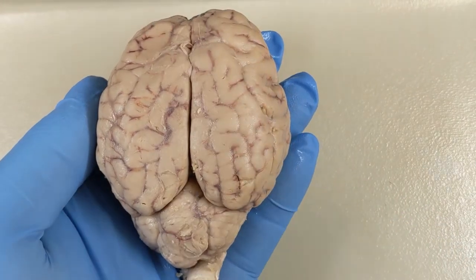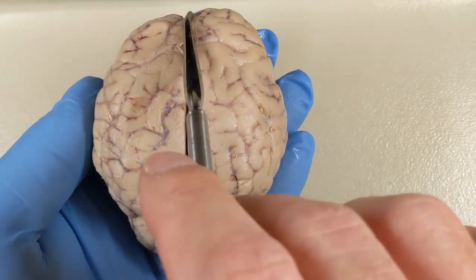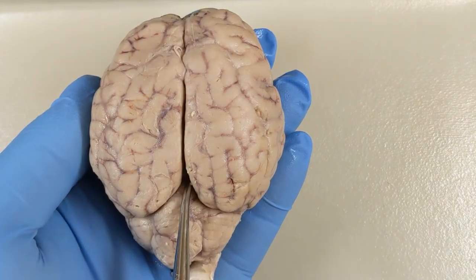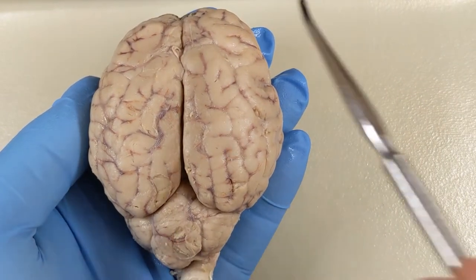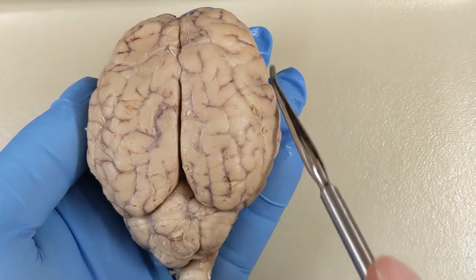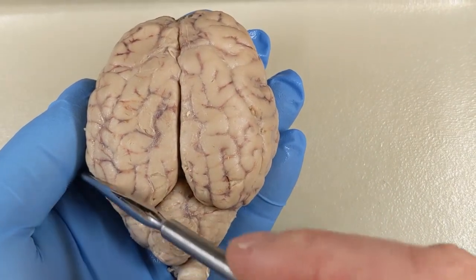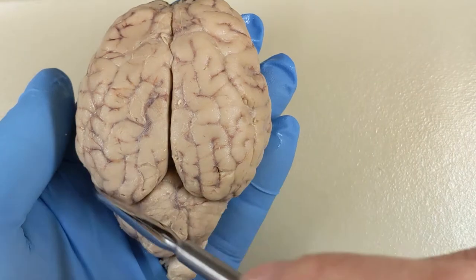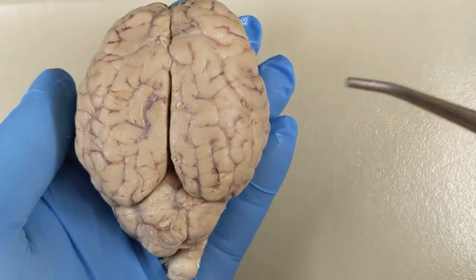Let's review the structures on the dorsal view of the sheep brain. Right down the midline, we've got the longitudinal fissure, which separates the left and right cerebral hemispheres. So all of this is the cerebrum, and then each side is a cerebral hemisphere.